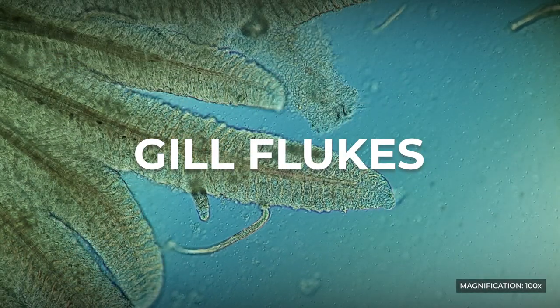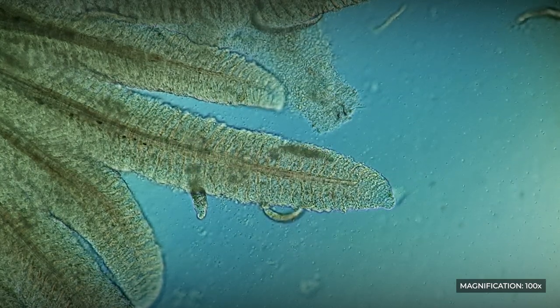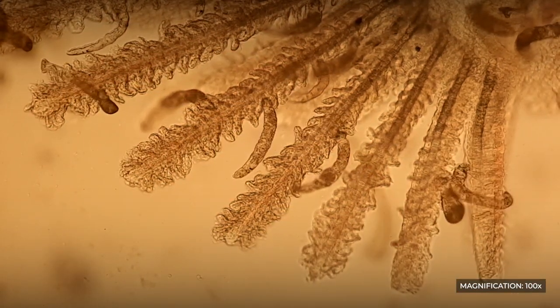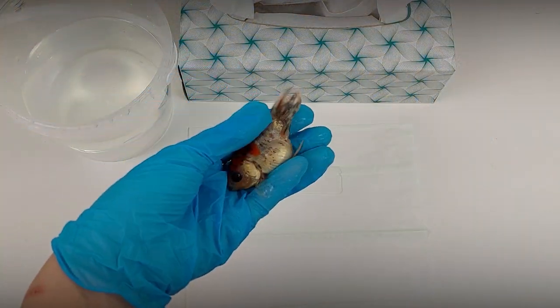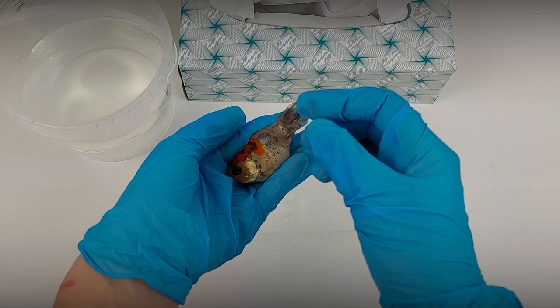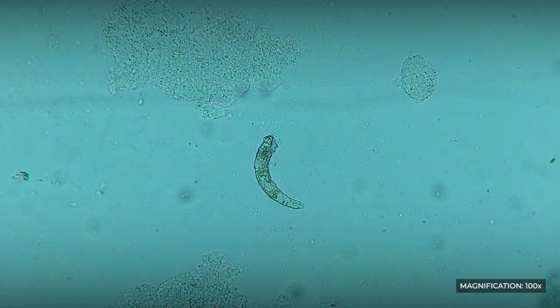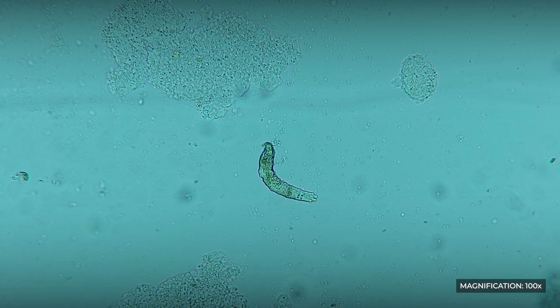Gill flukes: The group of gill flukes, consisting of several hundred species, also belongs to the class Monogenea. As the name suggests, these worms parasitize on the gills of fish. However, gill flukes are often found not only in scrapings from fish gills, but also in scrapings taken from the gill cover or pectoral fins of fish. When the parasites multiply in large numbers, they frequently extend beyond the gills.